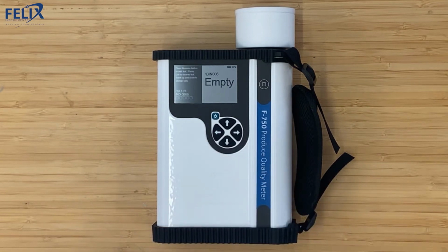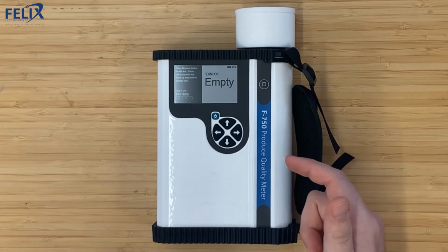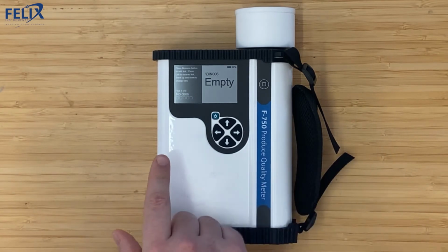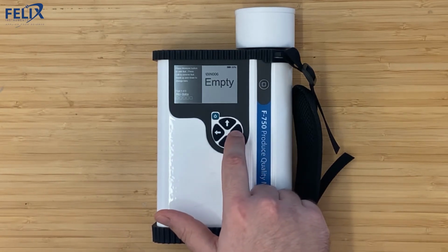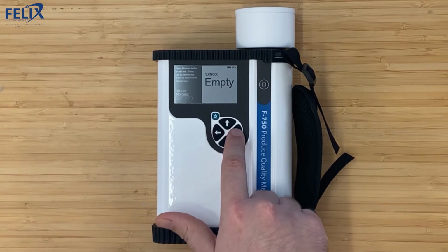You'll notice there's a lot of changes to the new home screen for the Avocado application. Mostly you'll see that there is a bin number. That is a grouping of fruit. We just use the bin designation. And then it says empty underneath, which is where a value will typically be displayed for an average dry matter. And then on the bottom left are various boxes which represent individual fruit. There are a lot of new elements on this display, and all of them are fully customizable by the user, as we'll see later on.